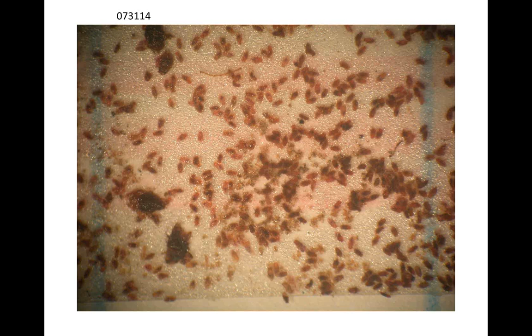When I was counting mine last week, I did see some morphological differences between some of those crawlers, but they all seem to be similar size, so I just counted them all as crawlers. That's why, you talked about the first stage being a crawler and then later stage nymphs. Some of those later stage nymphs, they still crawl around. They got legs and they crawl. And if they're able to move, I counted them as an immature.